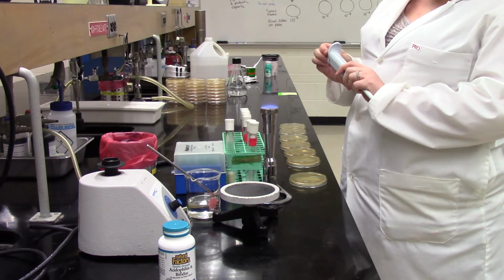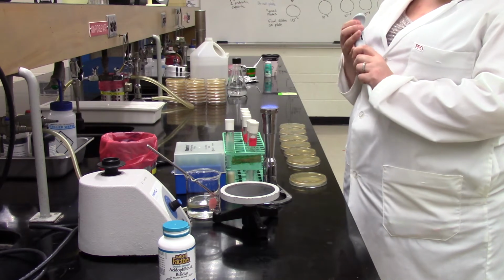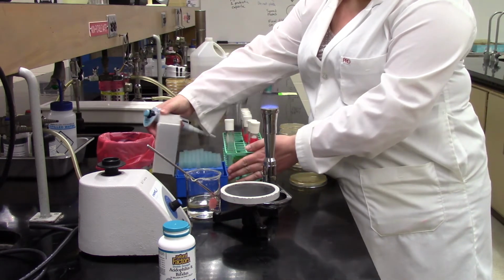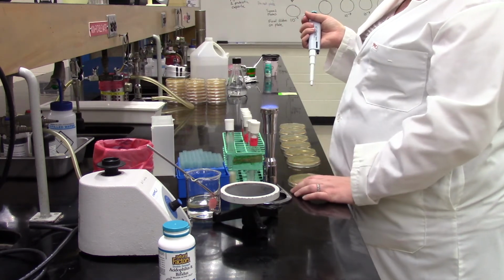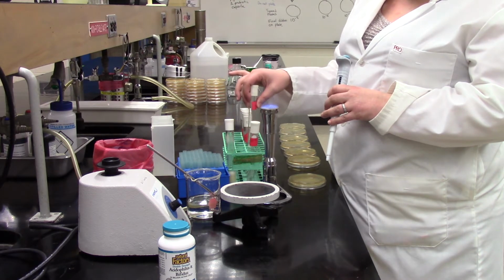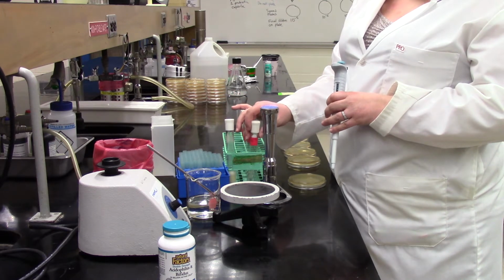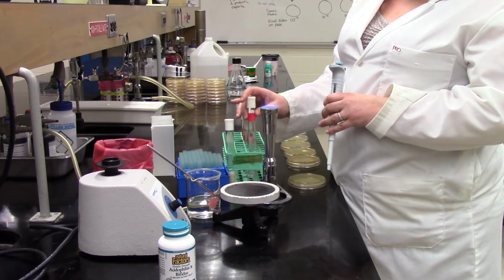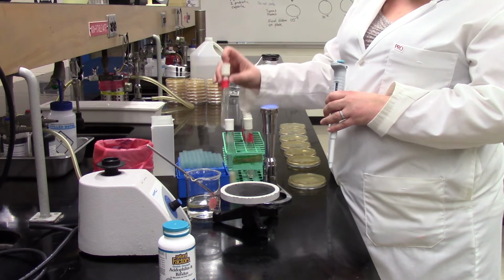So we showed you the big dilution series that we made all the way down to 10 to the minus 10. And now we're going to start preparing the spread plates. So you guys know the theory of this, this idea that if you can spread out a diluted sample of bacteria so that you get isolated colonies on an agar plate, you can count those, and then you can work backwards using the dilution factor of that sample on that plate all the way back to the original concentration of bacteria in the original sample. And from there, we can figure out how many bacteria were in the capsule. So we're going to start off with that.